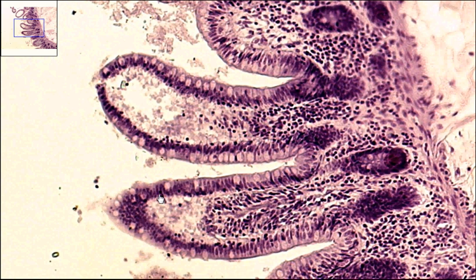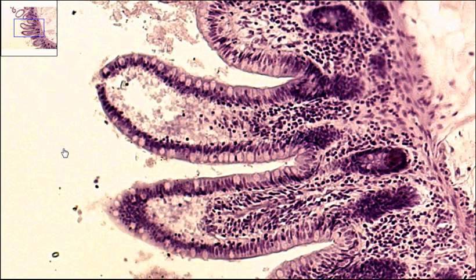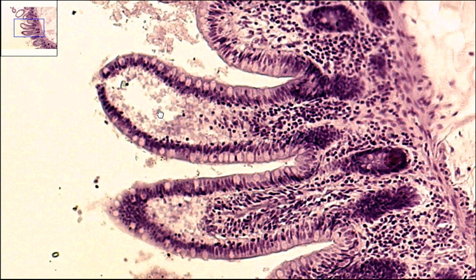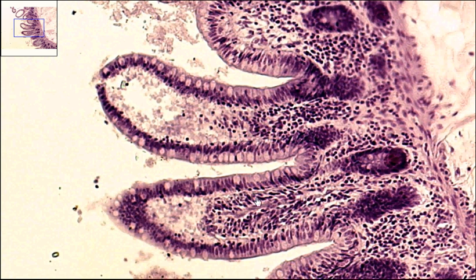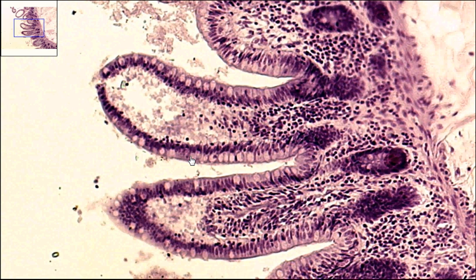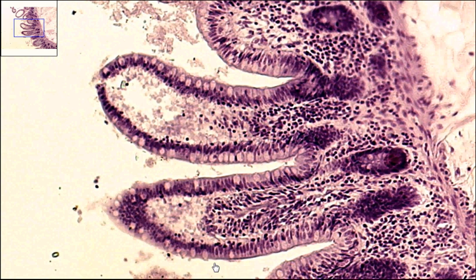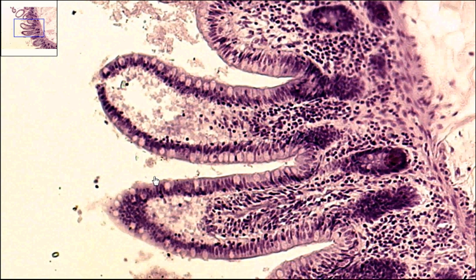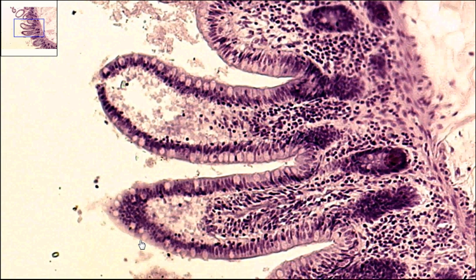Now if you notice, this area out here, which is kind of this off-white, would be the inside of the intestines. It's basically an open space, while this side of the epithelial tissue is filled with connective tissue. So when we're looking, we can see that this outside edge that is in the intestines — this is basically the exposed edge — this is the apical surface of the simple columnar epithelium.